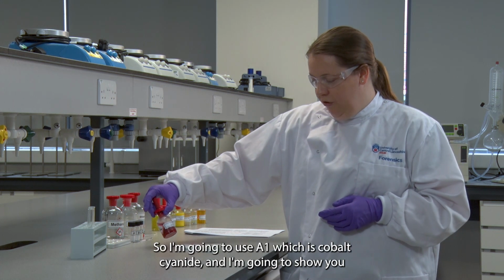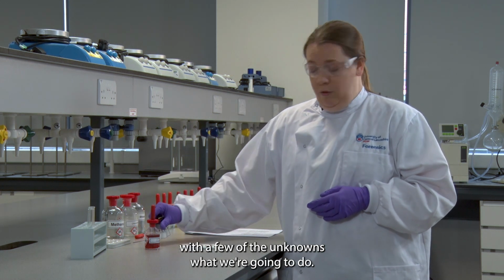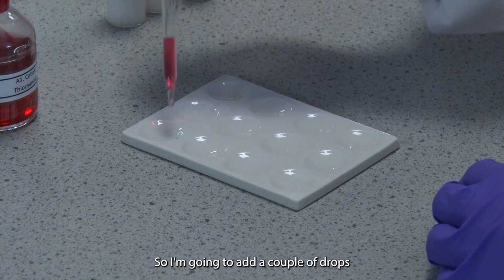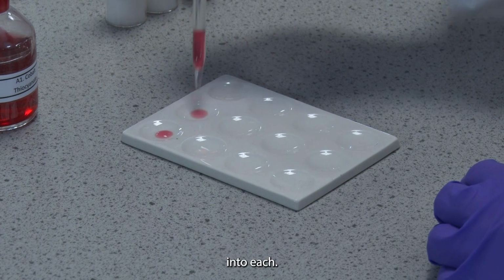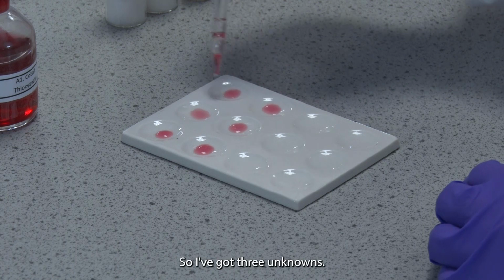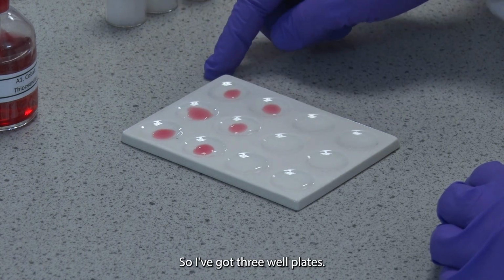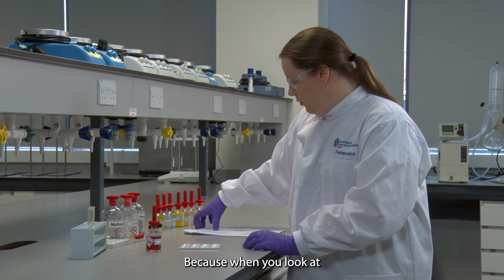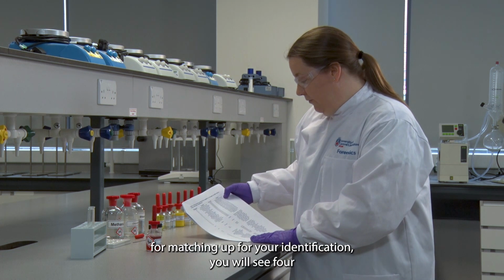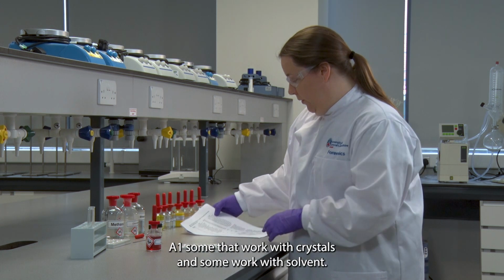So I'm going to use A1, which is cobalt thiocyanate, and I'm going to show you with a few of the unknowns what we're going to do. I'm going to add the test reagent. I'm going to add a couple of drops into each well, and I'm doing this twice. So I've got three unknowns, so I've got three well plates, and I'm doing this twice because when you look at the colour chart for matching up for your identification, you'll see for A1 some that work with crystals and some work with solvent.